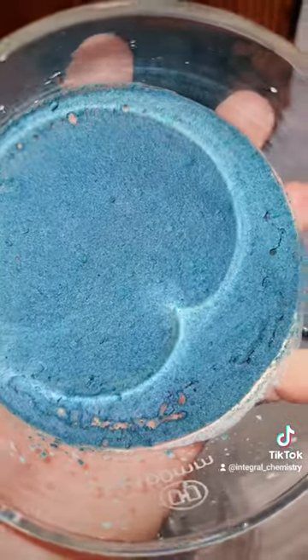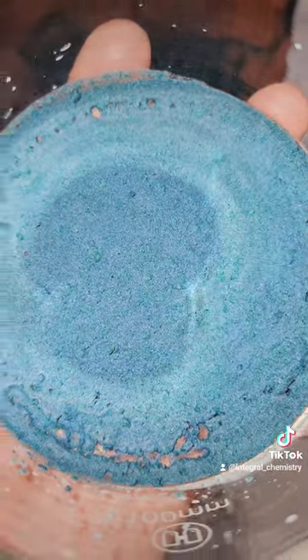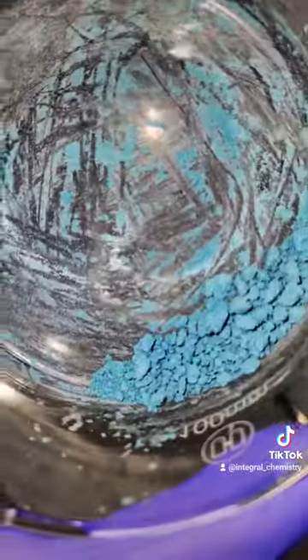In any case, once my pigment was cleaned and filtered, I transferred it to this crystallization dish to dry, and by the time it's done drying, it forms this nice blue powder.